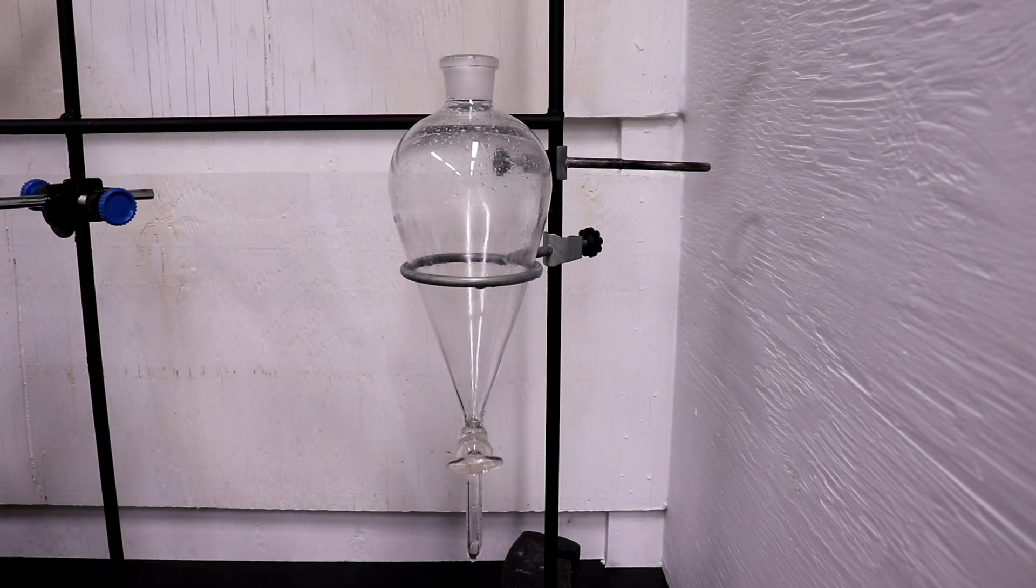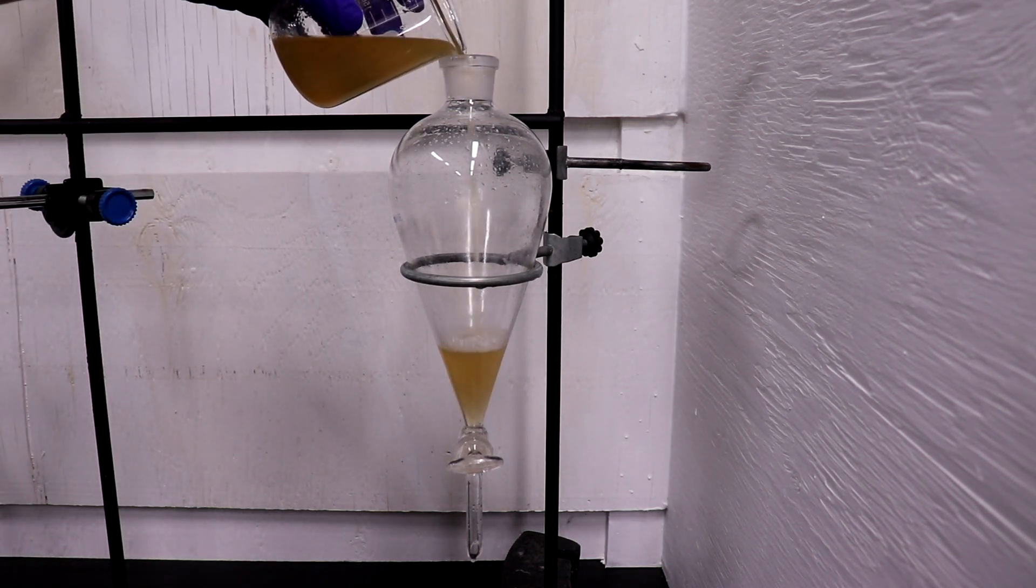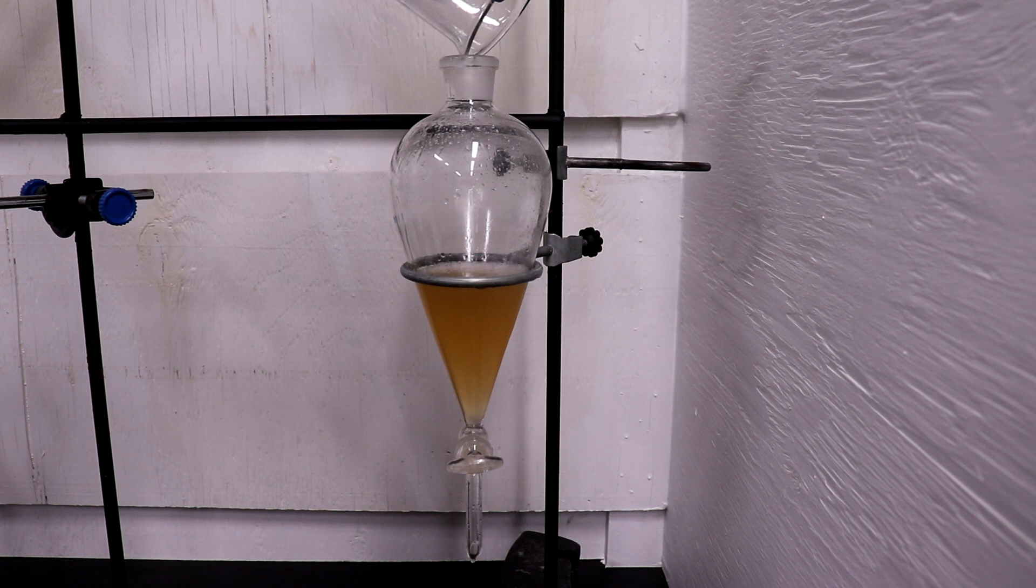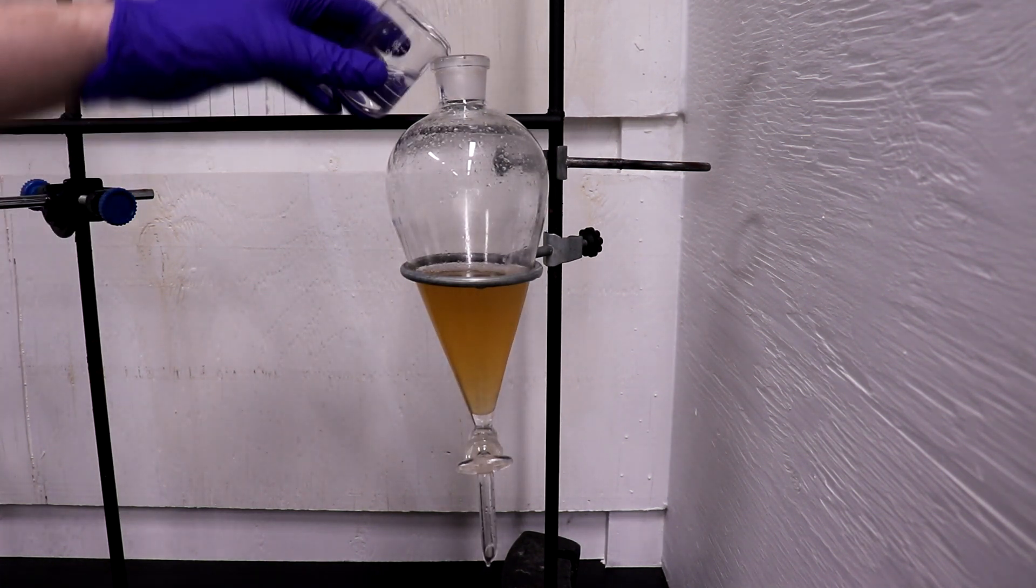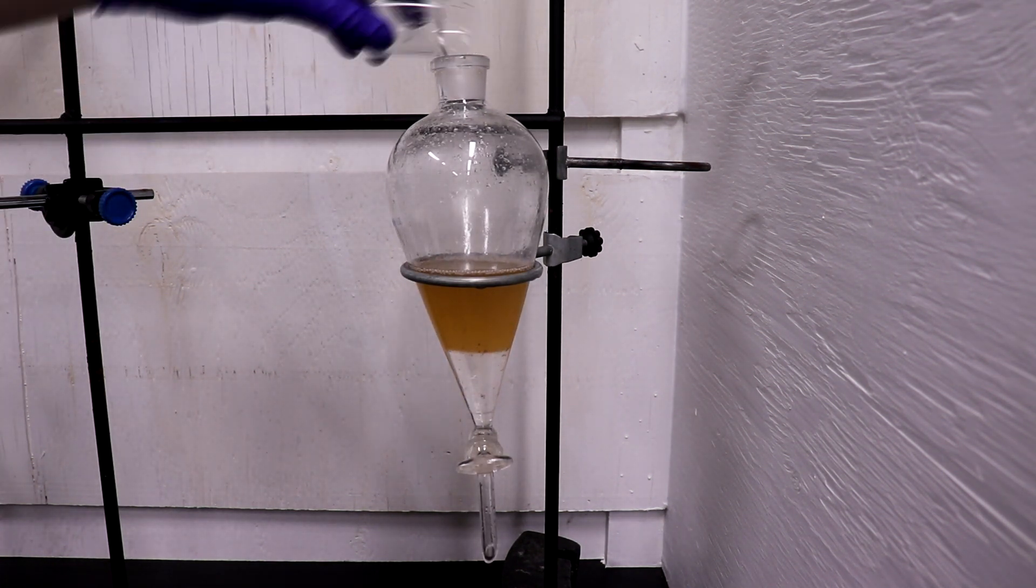The combined organic layers were shaken with 25 mls of 10% sodium hydroxide solution, then 25 mls of water, and finally dried over anhydrous magnesium sulfate.